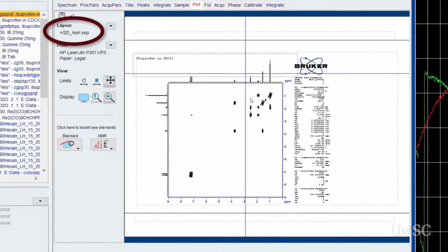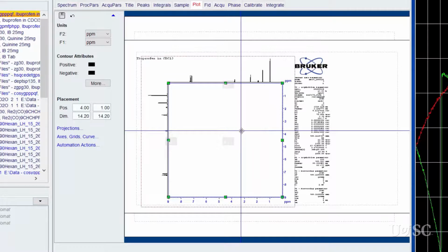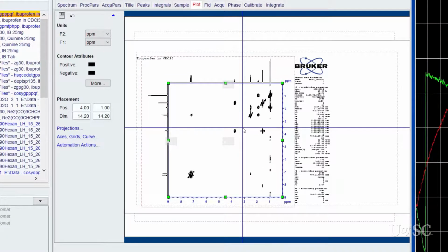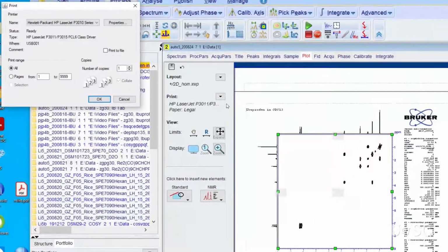2D_hom.xwp. The vertical intensity of the projections can be adjusted by carefully clicking in the region and using either the mouse scroll wheel or the intensity icon buttons. The intensity of the 2D contours can be adjusted after you click in the 2D spectrum area. To send the output to the printer, return to the main panel and select Print from the pull-down menu under the Print section. Then click on the OK button.